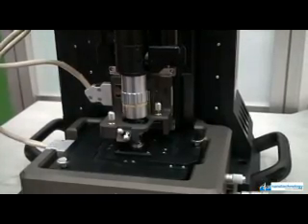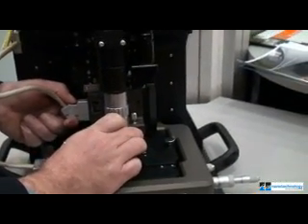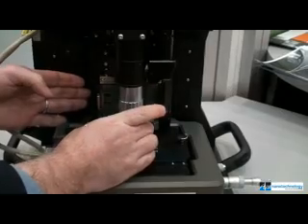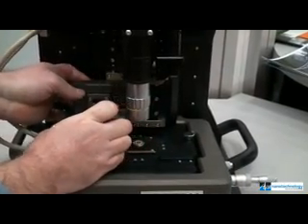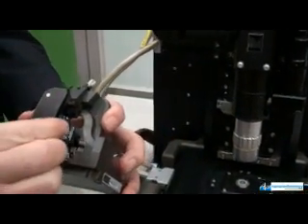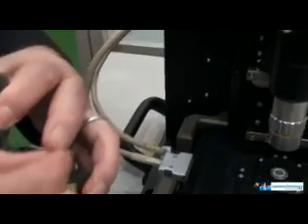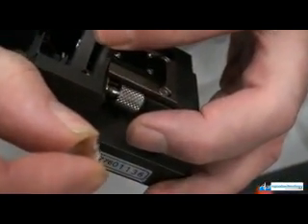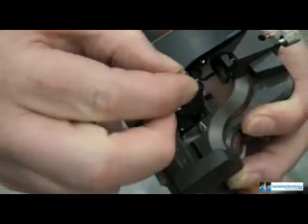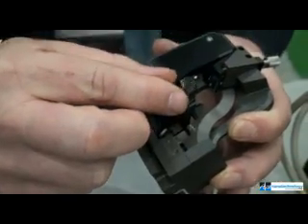The XY and Z components are completely decoupled in their scan systems. Removing the XE head gives a better view of the Z scanner where the tip is mounted. For NSOM technology, aperture or aperture-less cantilevers are used, mounted onto standard magnetic chip mounts. The tip is glued to the end of a metal wafer, which attaches to magnets at the bottom of the Z scanner scan head.